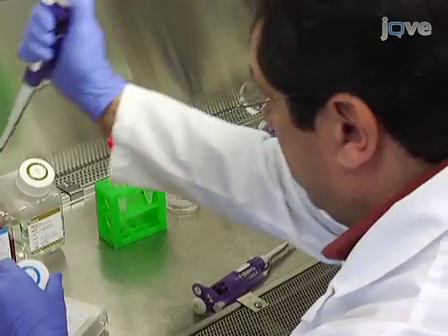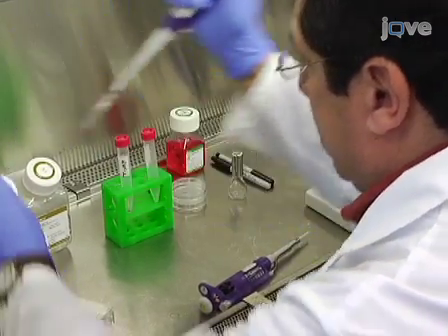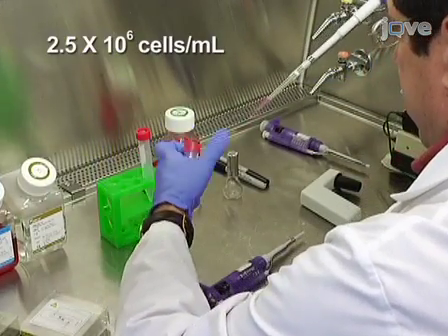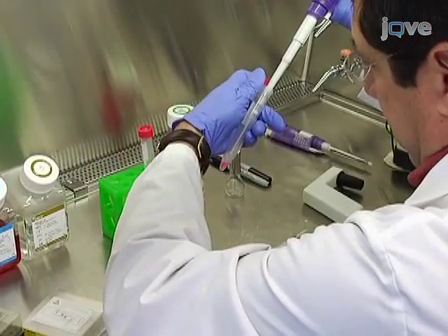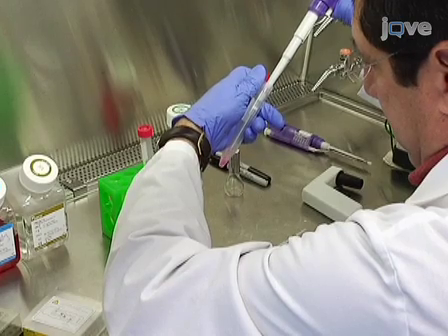Adjust the cell suspension with media to a final concentration of 2.5 x 10⁶ cells per milliliter. Then proceed to the formation of hanging drops.